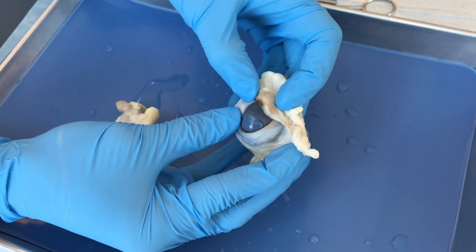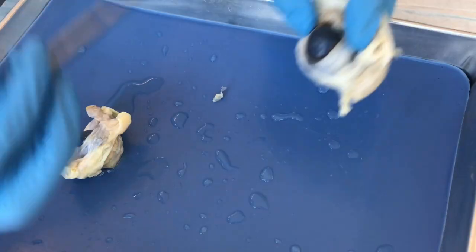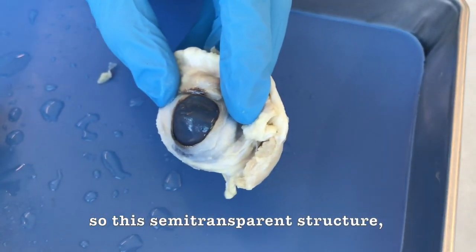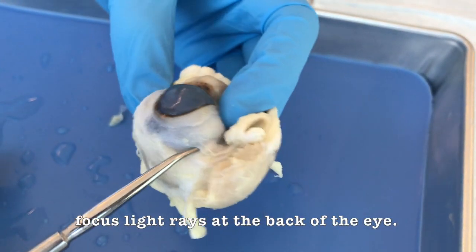This is the eyelid, which protects the eye and keeps dust and debris out, so you can see that right here. This right here is the cornea, this semi-transparent structure, which is the anterior covering of the eye, and it helps to transmit light and focus light rays at the back of the eye.